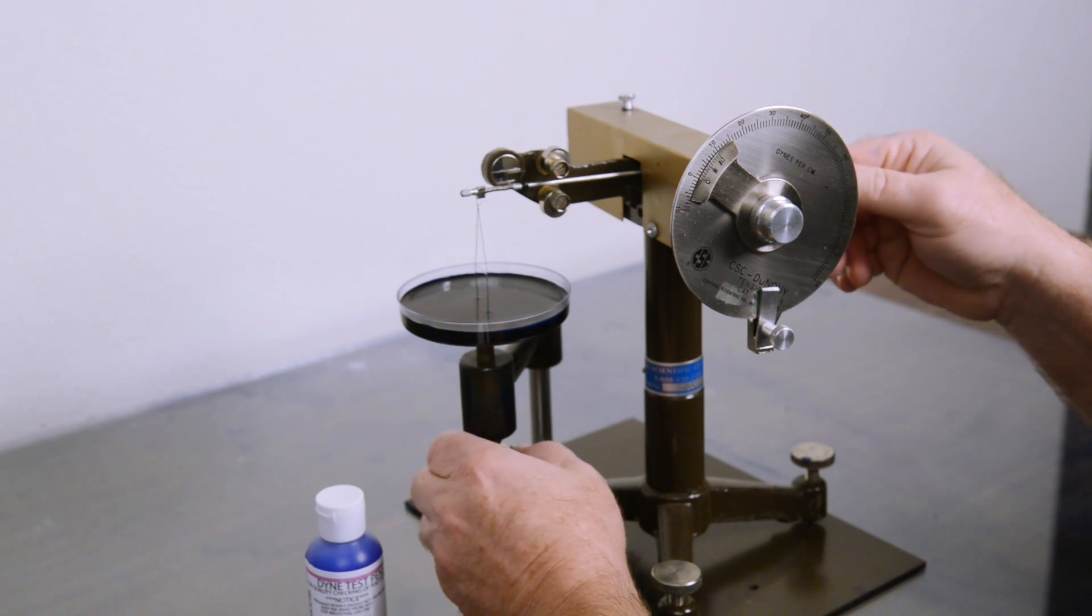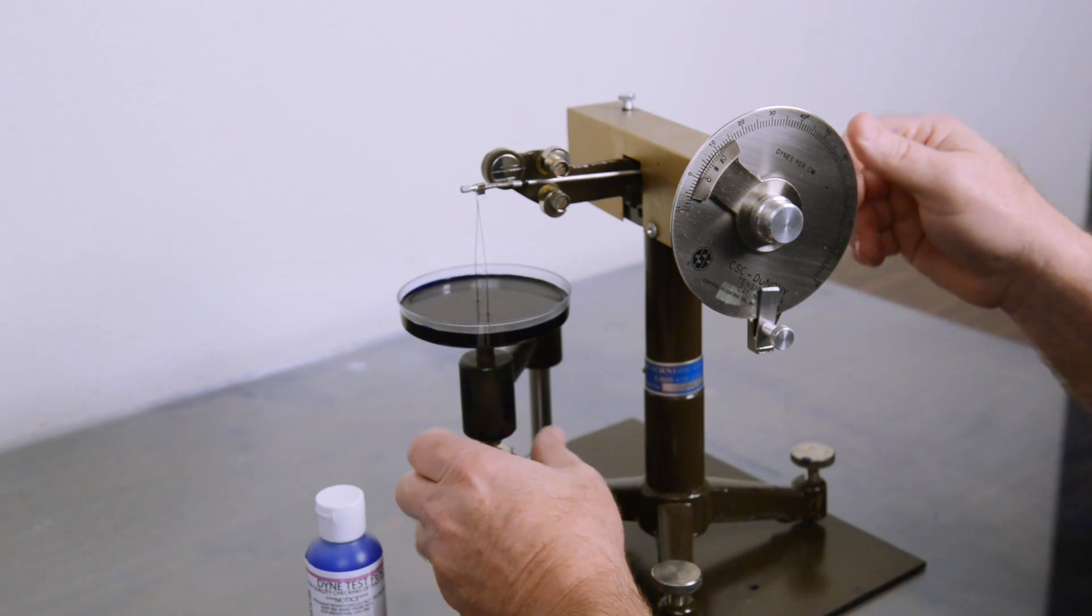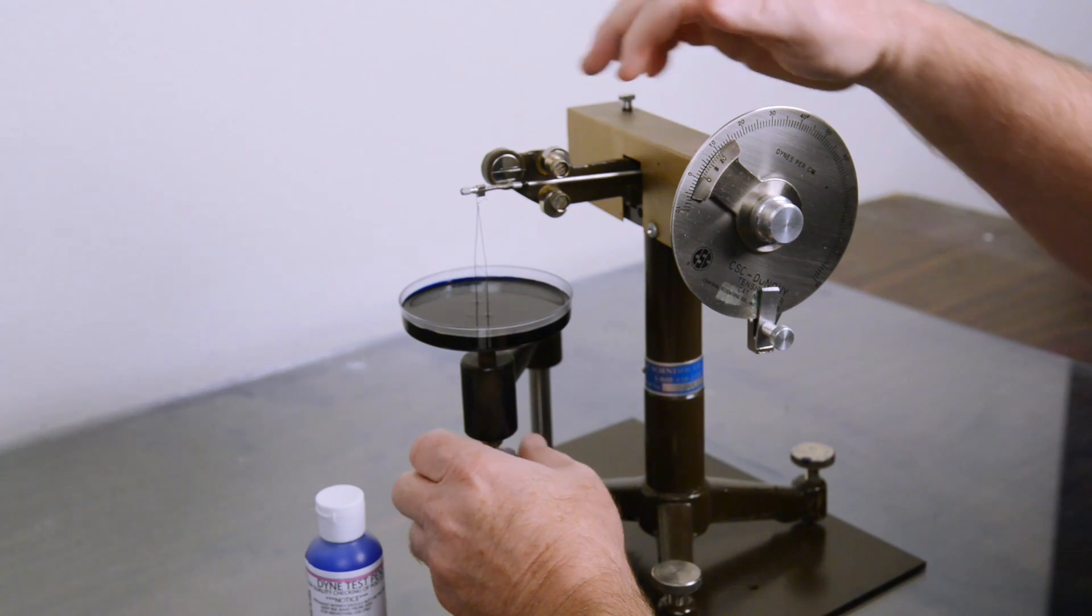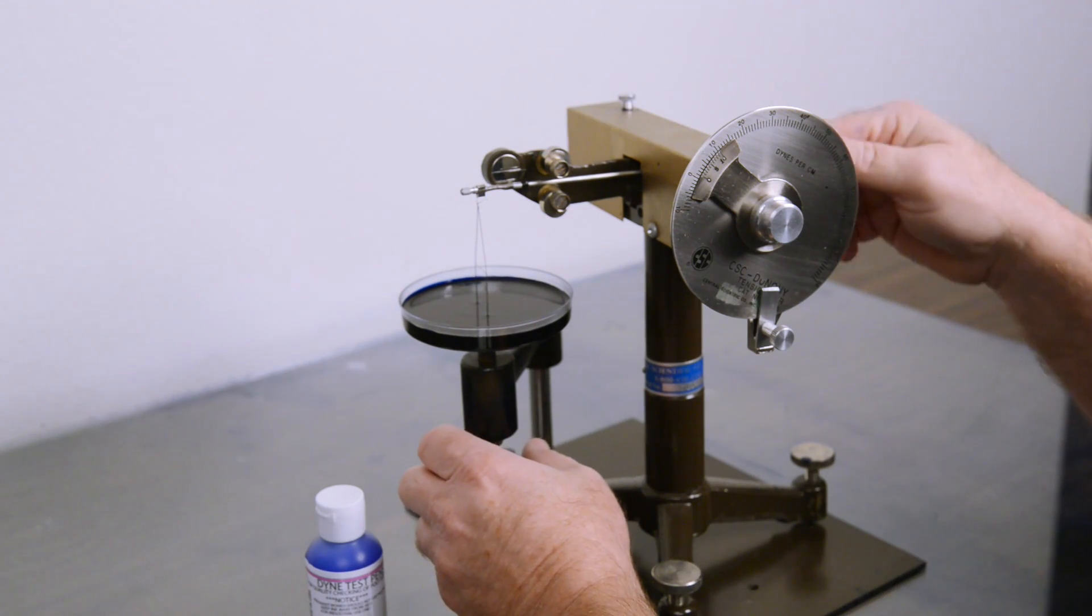Then we are going to lower the arm so that there is some tautness on the dish, showing where the line is still lined up.